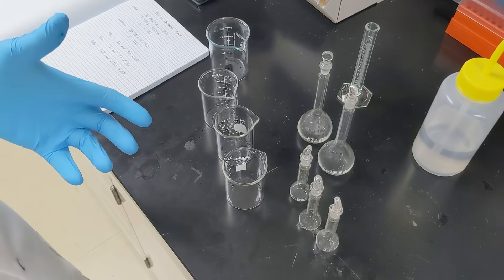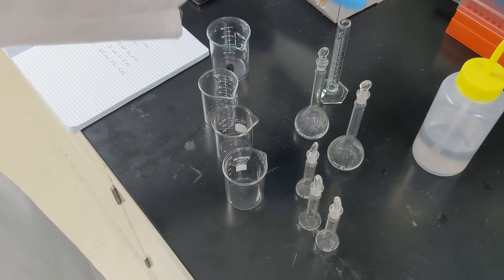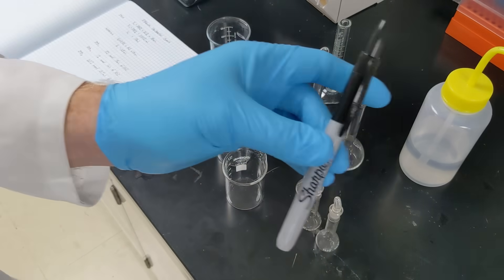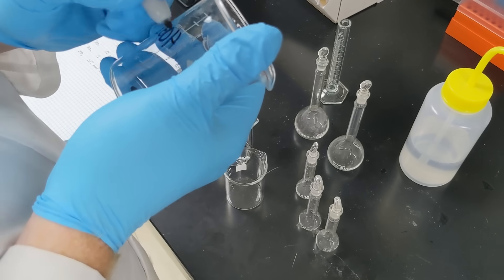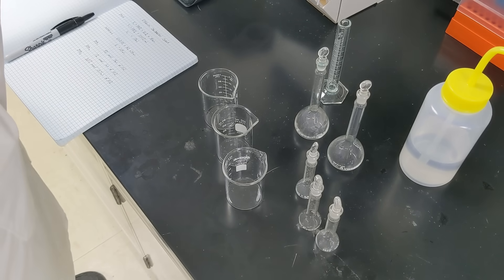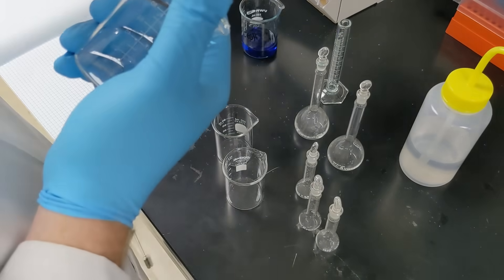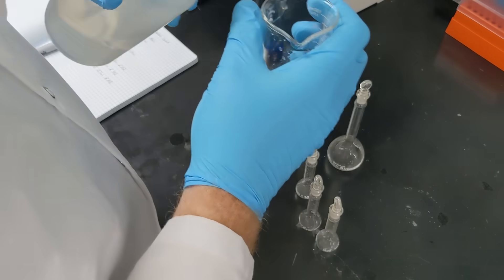Now that we're in the lab, we've collected all the glassware we're going to need: some beakers, our 50-milliliter volumetric flasks, our 10-milliliter volumetric flask, a graduated cylinder, some water, our ethanol, our laboratory notebook with calculations laid out, a calculator to double-check, and a marker to label everything. First thing we're going to do is label our beaker 'ethanol' and pour some in. I've dyed this ethanol blue so it shows up better on camera. Then we label a beaker 'water' and pour some water in for our dilutions.